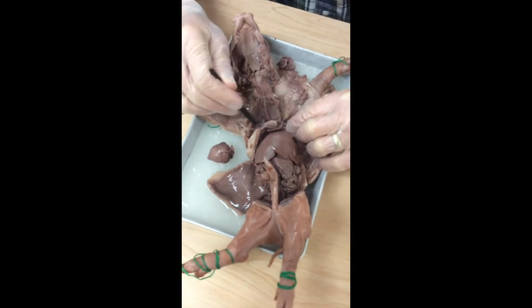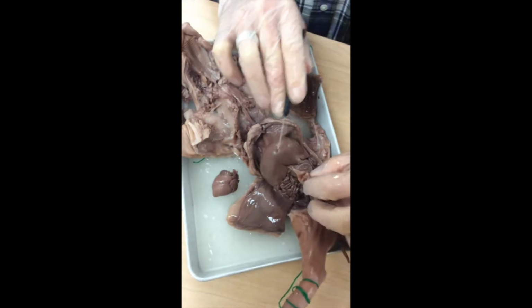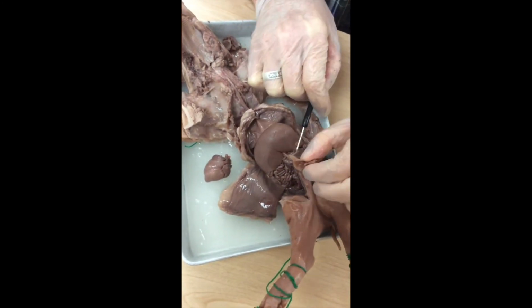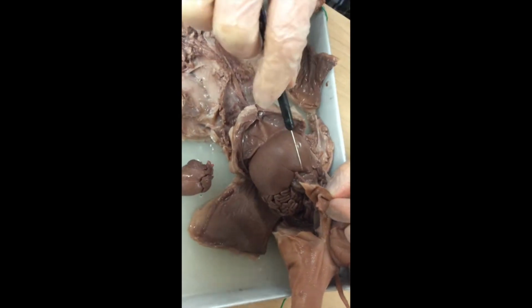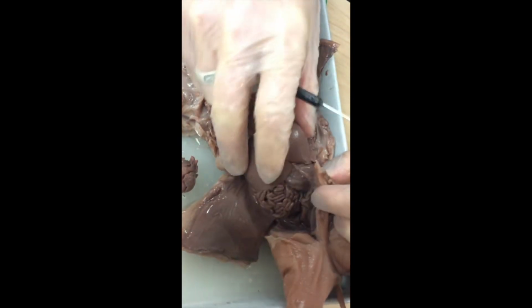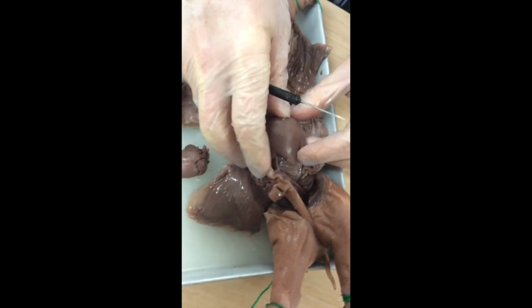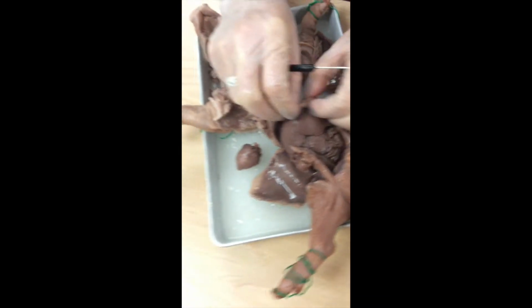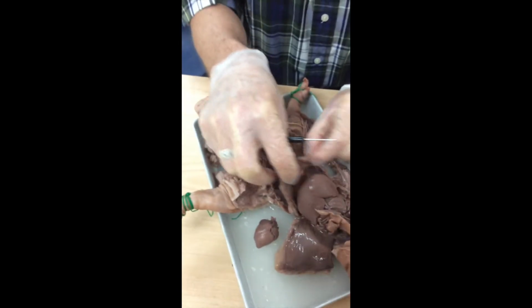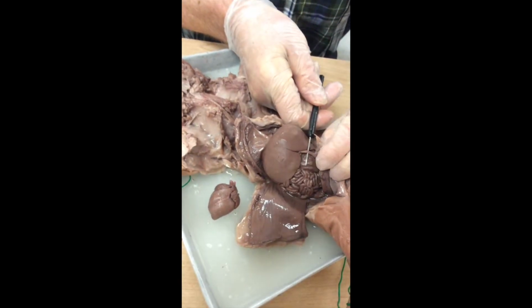All right, a couple of things we're going to look at from the get-go. We've got our umbilical cord, and you notice that we have a vessel extending from that umbilical cord through this big brown organ right here. This is the liver. That's the largest, well, I shouldn't say it's the largest, it's a very massive, huge organ. Immediately on the back side of the diaphragm, I'm flapping the diaphragm here. This is called the umbilical vein.